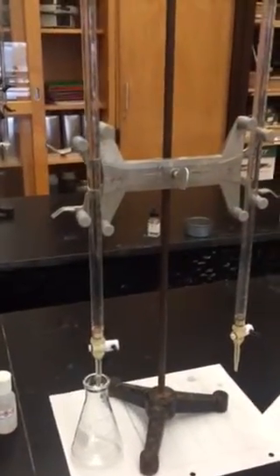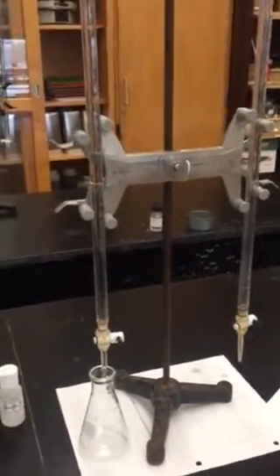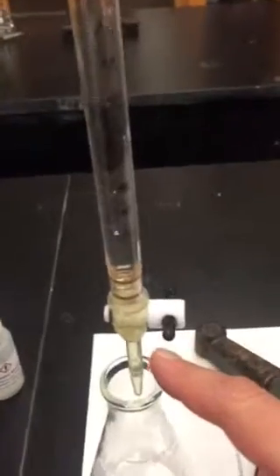Before you go ahead and use the burettes, you want to make sure: one, that they're filled, and two, that the tips of them have acid or base in them — they should have been let out. You shouldn't see any bubbles down here in the tip.